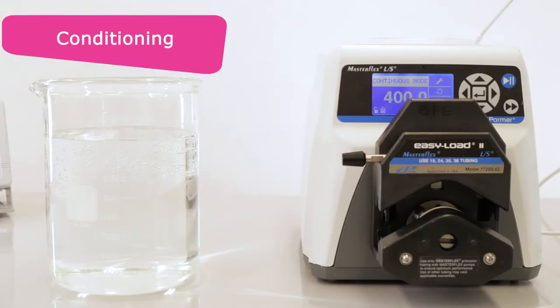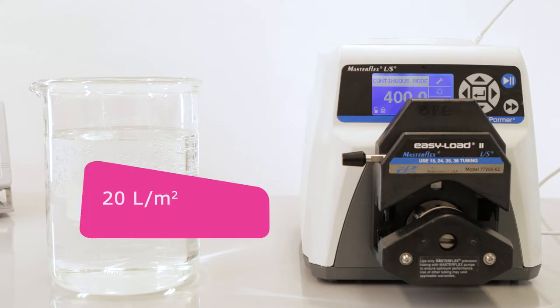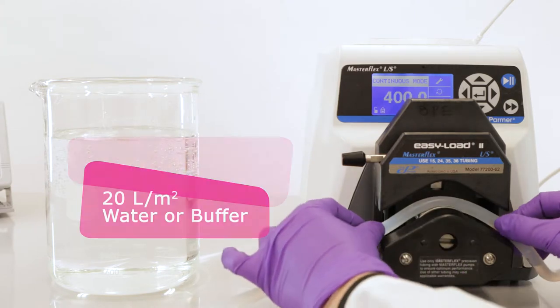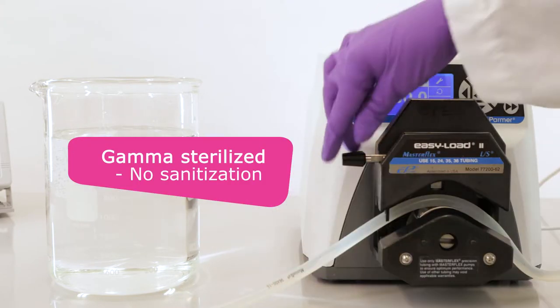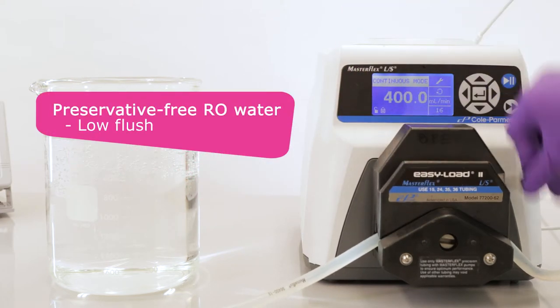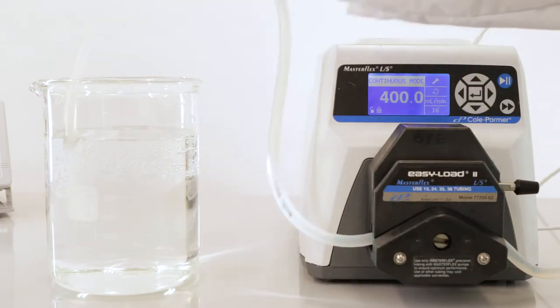You may then condition your TFF system with a buffer flush, as the capsule is supplied gamma-sterilized and with preservative-free reverse osmosis water for reduced pre-use requirements.